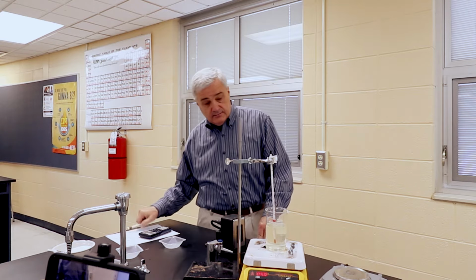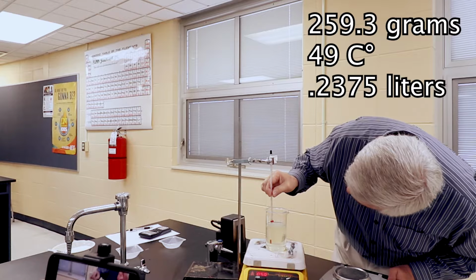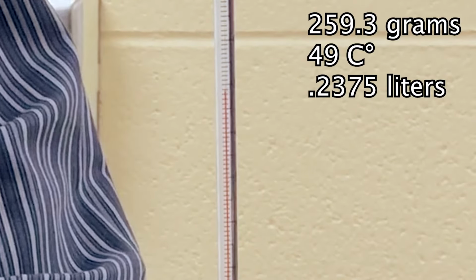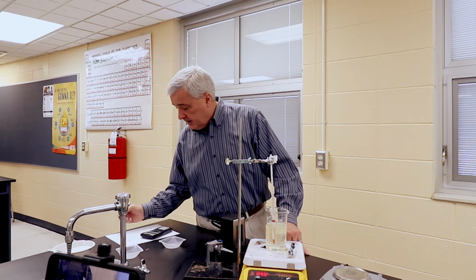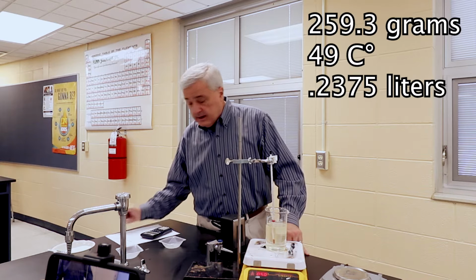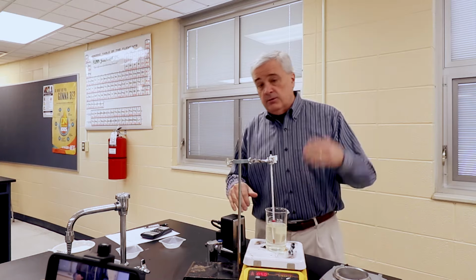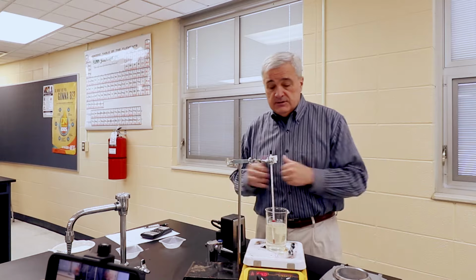259.3 grams at, I'll turn this so I can see, I'm going to call it 49 degrees. At 49 degrees Celsius, 259.3 grams. All right, we're going to turn the temperature up again. We're going to try to get up to 80. So we'll do 20, 50, and 80. And let's see what happens.